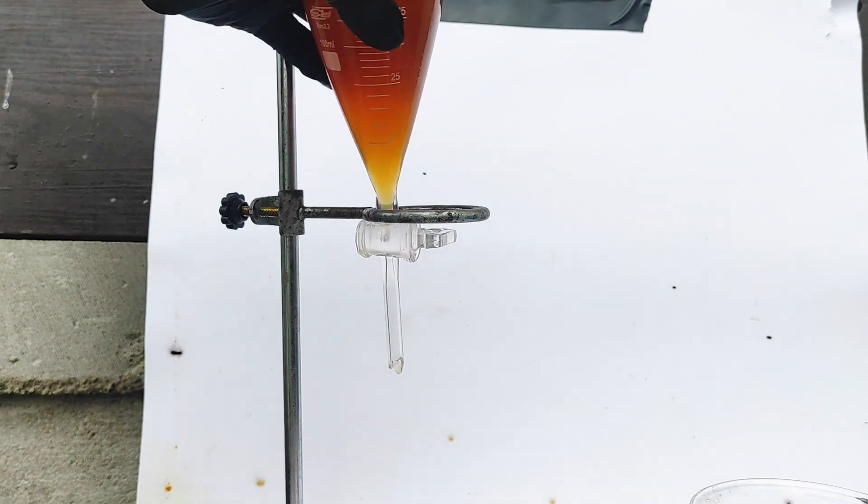However, I haven't edited it yet, so here's the end result. It's kind of sad that all of the bromine that I've made ended up in this small vial, and now that I don't have any bromine I've decided not to make any toxic volatile liquids like bromine until I get an actual fume hood.